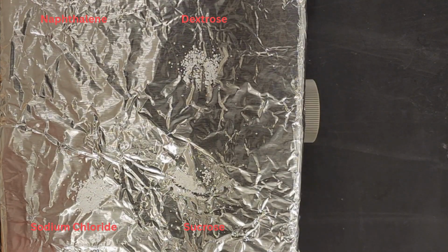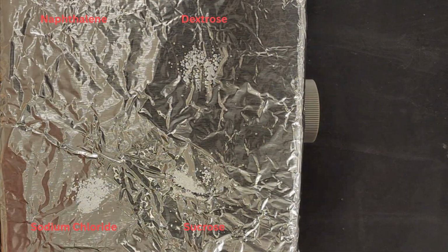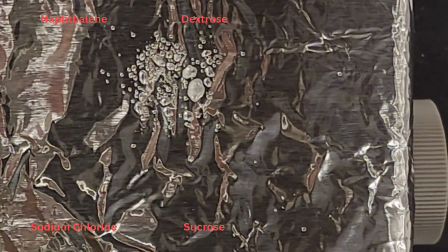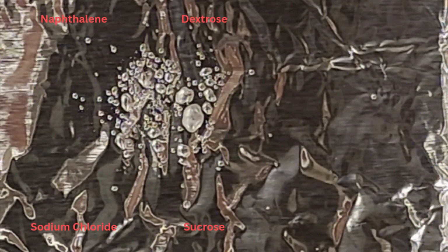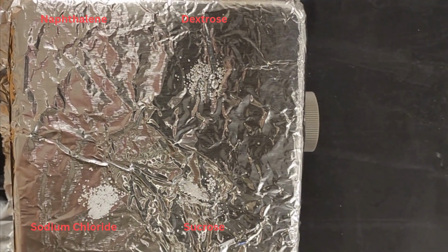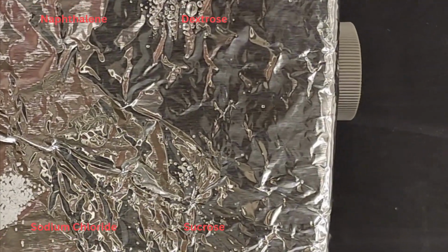After about 4 minutes had passed since turning on the hot plate and 1 minute had passed since the naphthalene began melting, you can see in the upper right-hand corner that the dextrose began melting very quickly as well. Not long after, the sucrose in the bottom right-hand corner also began melting, and the two melted very quickly.